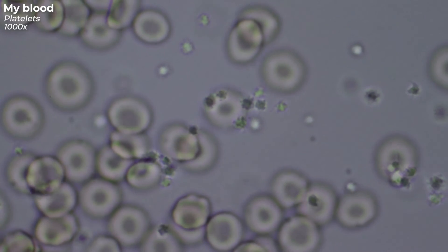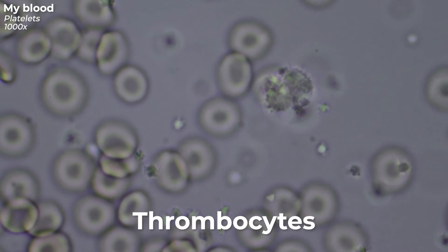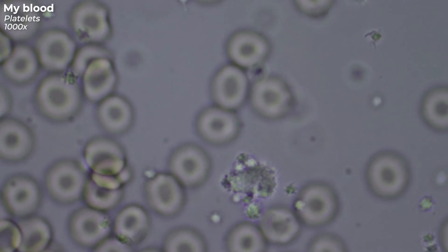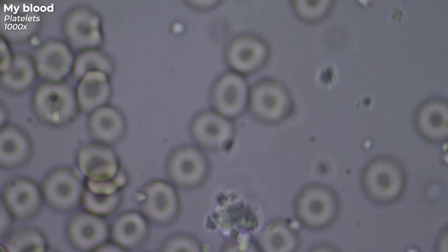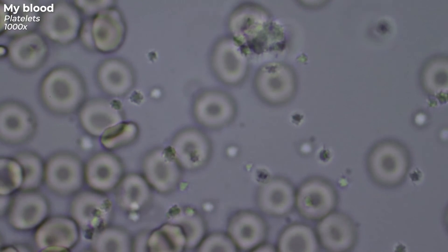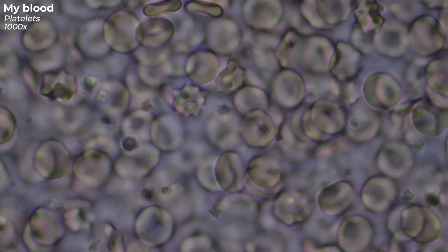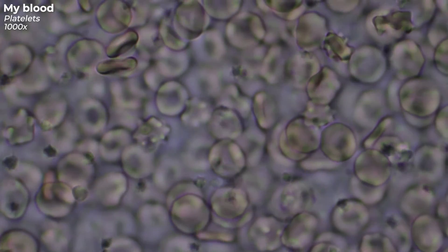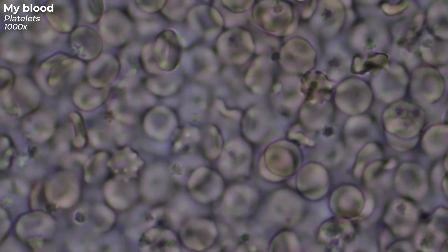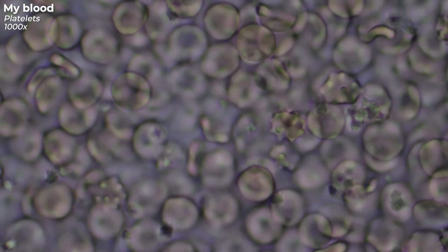However, blood does not only consist of red blood cells. These cells are platelets, also called thrombocytes. They are the smallest cells in our blood and play an important role in blood clotting. When a blood vessel is injured, these platelets attach themselves to the surrounding tissue to close the injury. So if you have too few platelets in your blood, you should expect an increased tendency to bleed — for example, spontaneous nosebleeds may occur. If you have too many of them, the risk of arterial thrombosis is higher. In a thrombosis, many of these platelets stick together and form a blood clot called a thrombus, blocking veins or arteries. This can be life-threatening because the blood flow and thus the transport of oxygen to the cells is disrupted.